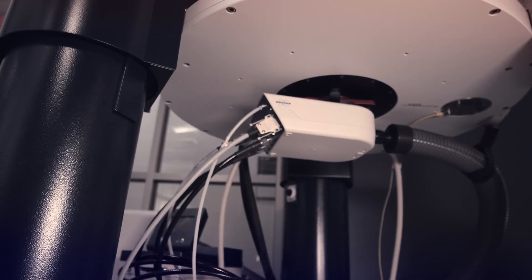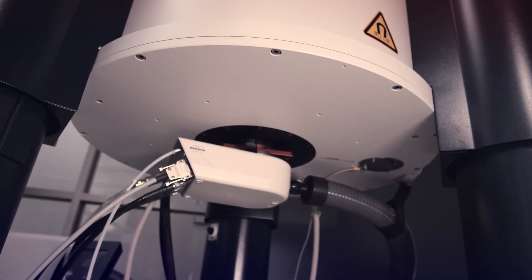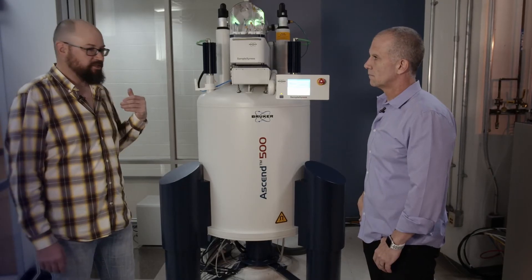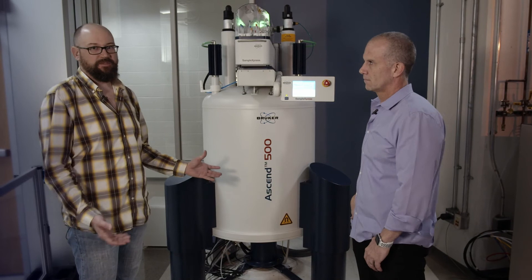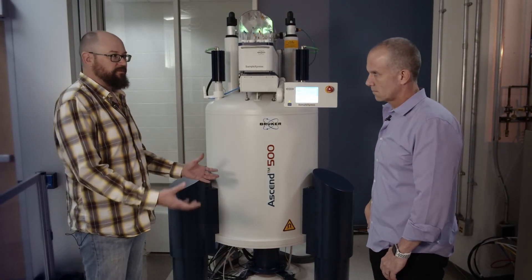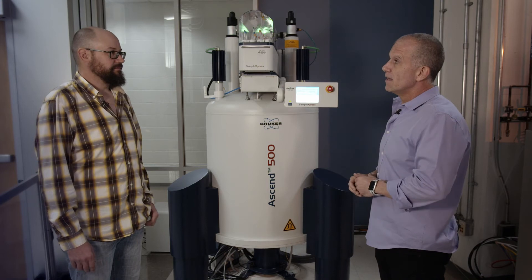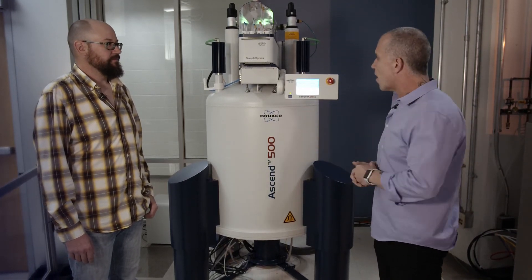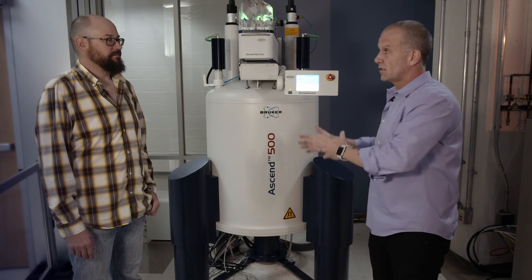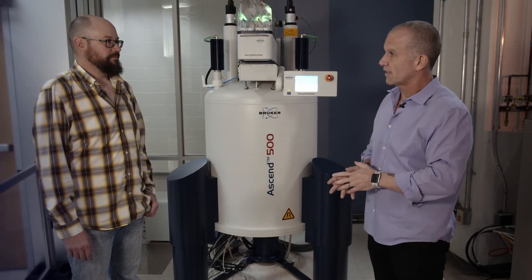The first thing inside the bore of the magnet coming in from the bottom is a set of shims that we use to make sure we have a perfectly homogeneous magnetic field. Inside that then comes the probe, which is our antenna. It allows us to not only excite the spins but detect our signals. One of my jobs is choosing which probe to put in there for different experiments — whether that's a protein requiring high sensitivity, triple resonance, different nuclei, or solid state. We have different probes for each of those tasks, and while probes are getting more multifunctional, it's still fairly rare not to have more than one probe, especially for major modalities like solids versus liquids, or specialty probes for exotic nuclei or temperature ranges.